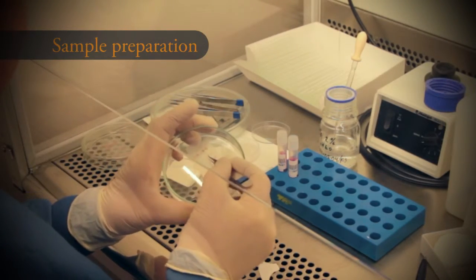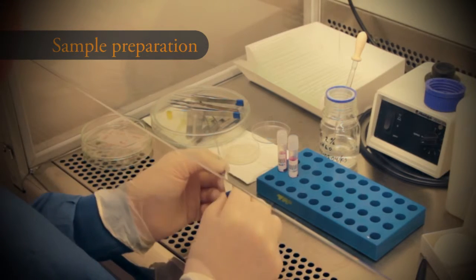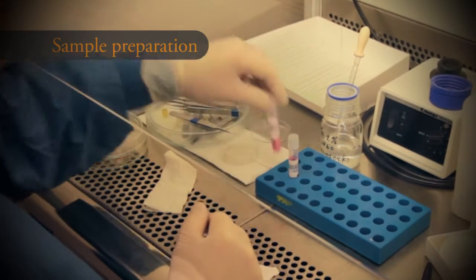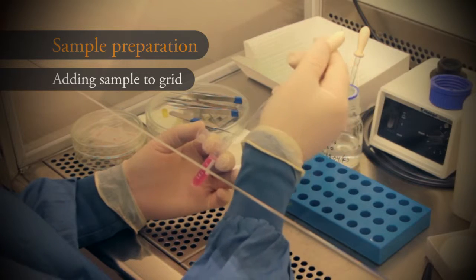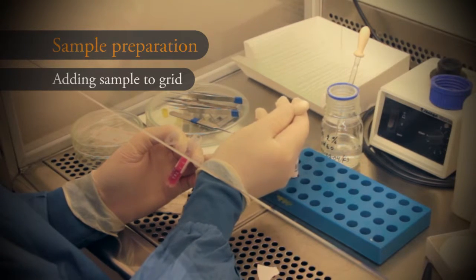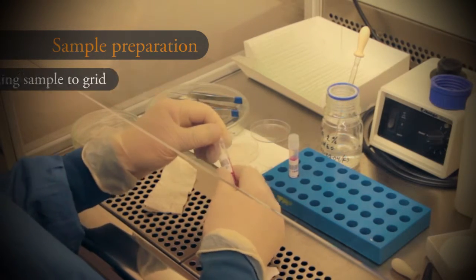Virus samples are prepared for imaging using transmission electron microscopy for identification of the virus. Samples are inactivated and stained using simple preparation protocols. The method uses cheap, off-the-shelf reagents that are stable at room temperature. The procedure is straightforward and fast. The whole process takes around 15 minutes.